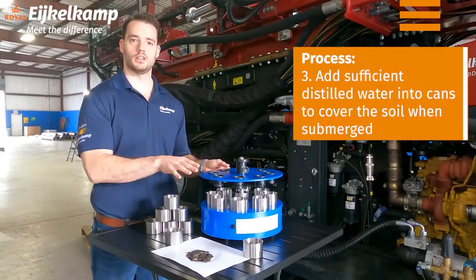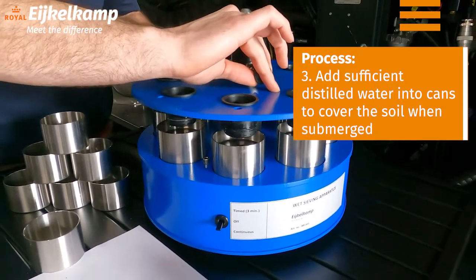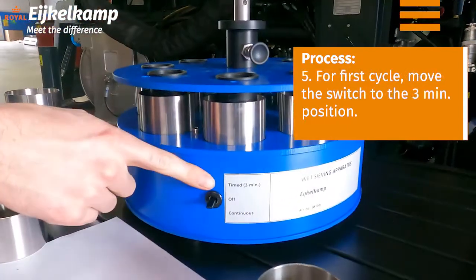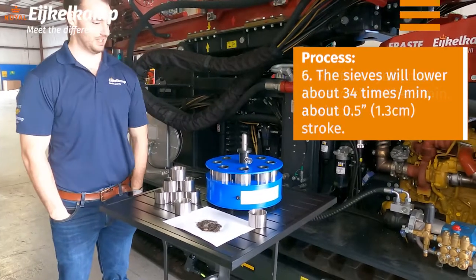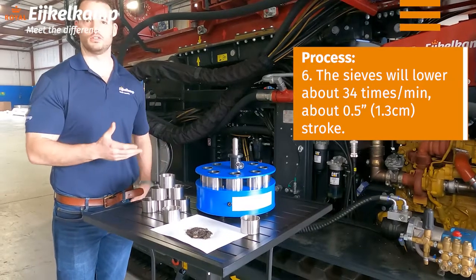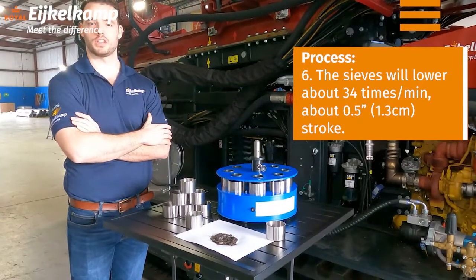We've gotten our soil fully saturated — it's moisturized and it's ready to go. Pull out the locking pin from the upper location. You can see we've also filled our stainless steel cups with enough water to submerge the soil. Drop it down into place and it'll pop into place, and we're ready to turn it on. The system has two different modes: continuous or a three-minute timer. First thing we want to do is the three-minute timer, so we click it on. It's going up and down, just gently dunking the sample — it's not like a normal sieve machine with a lot of energy. This is a lot more gentle because we're looking at a different property here.